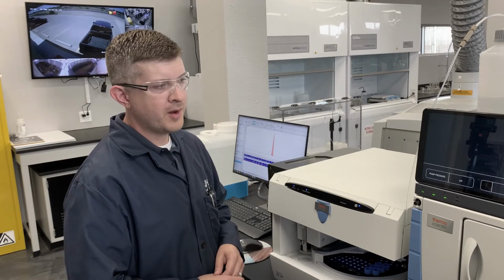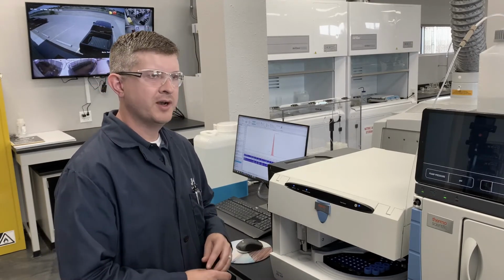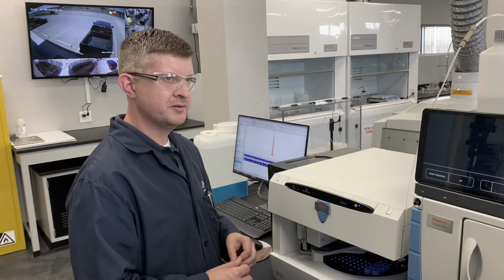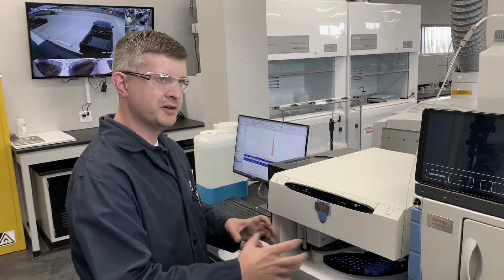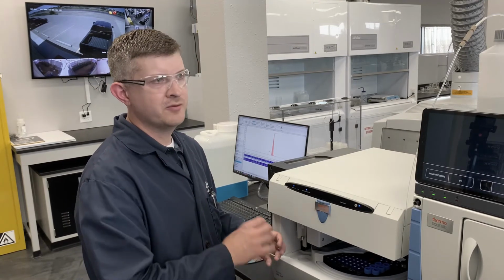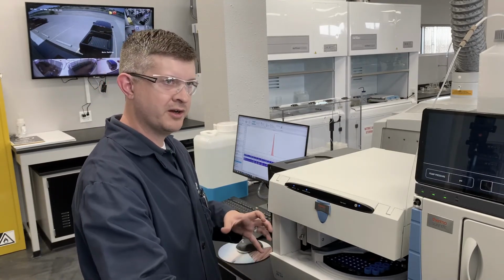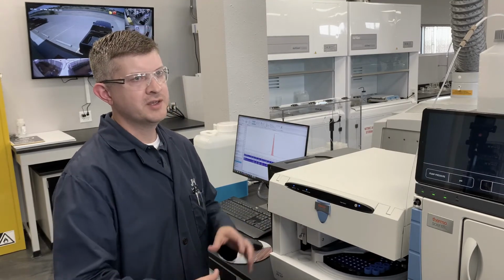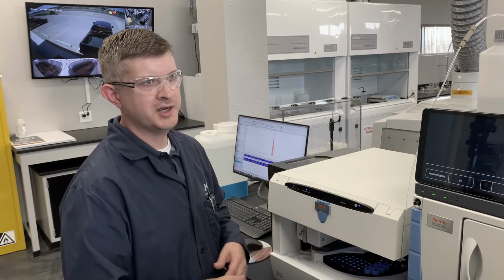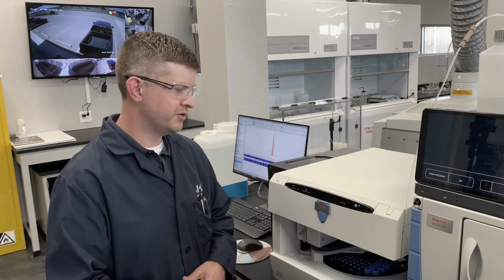Some people might think of it as kind of an added expense, but whenever you break it down and you see the time savings that it offers you, your technician can prepare 60 water samples and put them on the instrument within about 30 minutes, and then they have the rest of their day to go do other things. So instead of spending their entire day working on only chlorides and sulfates, they can prep it, they can get the ICP started, they can go do coupons if they want, they can run millipores. They're going to have all that time because of the automation that the IC provides.